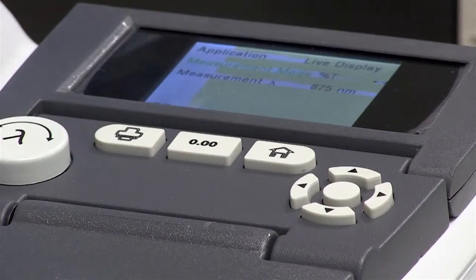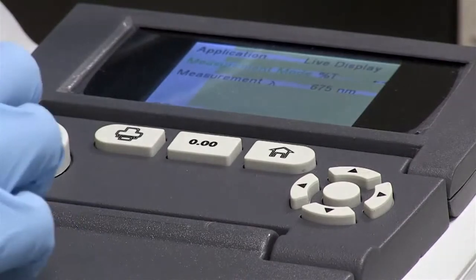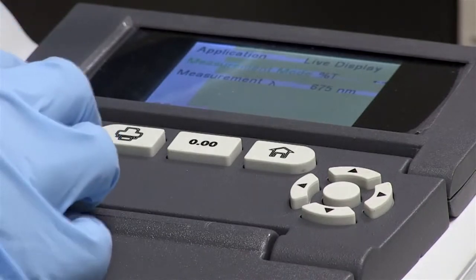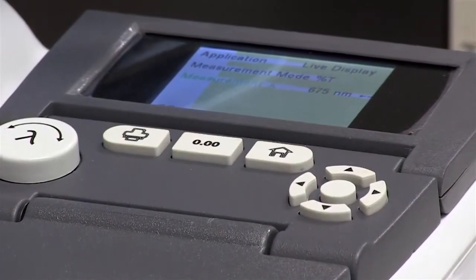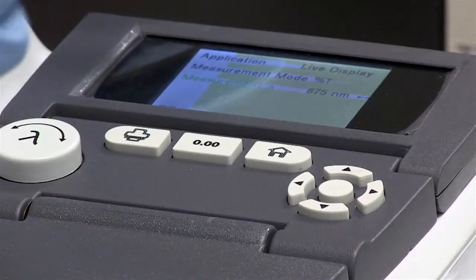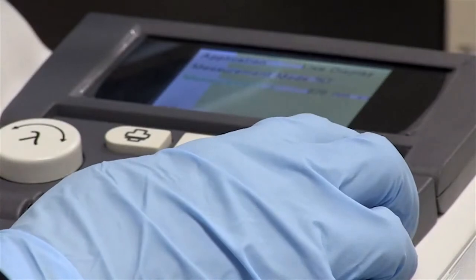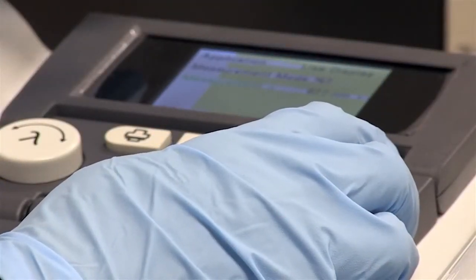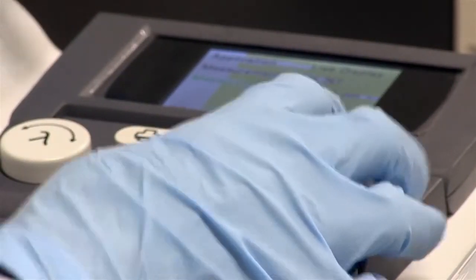If you want to change the wavelength at which you're reading your absorbance, you can use this dial here — if you notice, lambda is written on the dial. First you have to go to the measurement mode. Now you can change the wavelength by increments of one nanometer using the arrow buttons — going right brings it to 676, 677, and going left brings it back down to 676, back to 675.